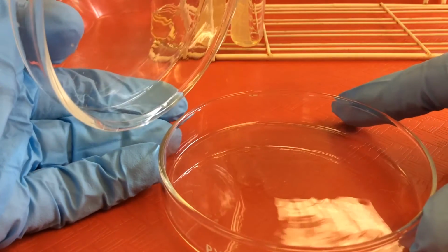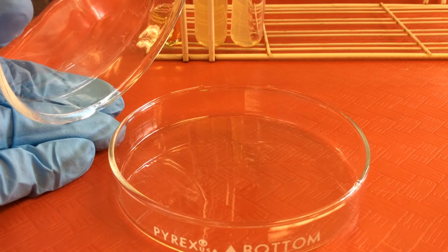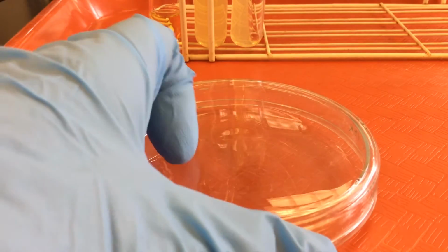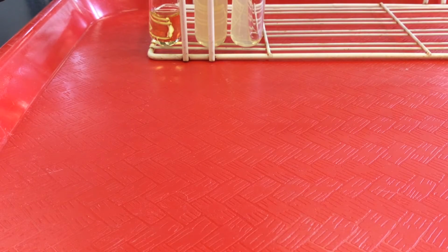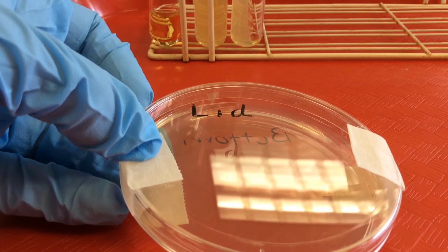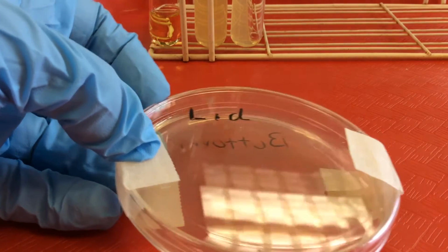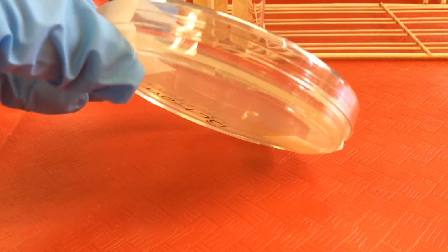All right. And with these petri dishes, what we do is, after autoclaving while the agar is still liquid, the liquid agar would be poured into the bottom of the plate, right, and then covered, and then permitted to solidify. So here we have an example of what we call an agar plate. In this case, this is a disposable plastic petri dish that's been filled with agar. Again, we see the lid is on top, the larger diameter, and the smaller diameter bottom, into which the agar has been poured.